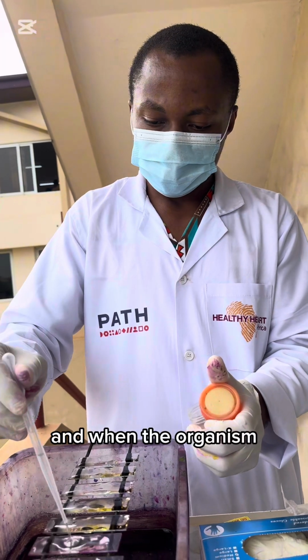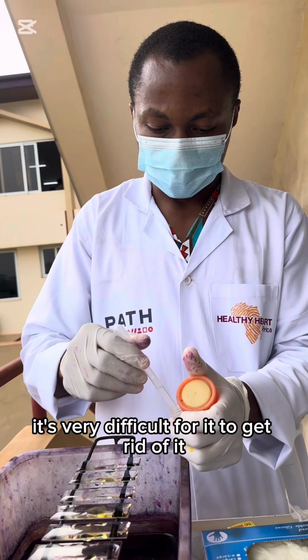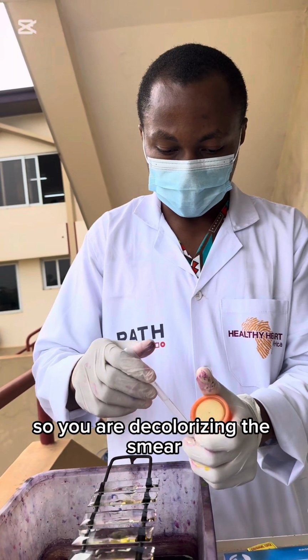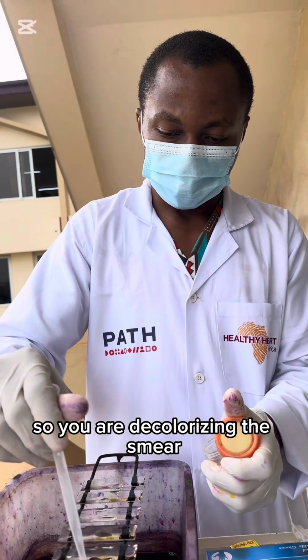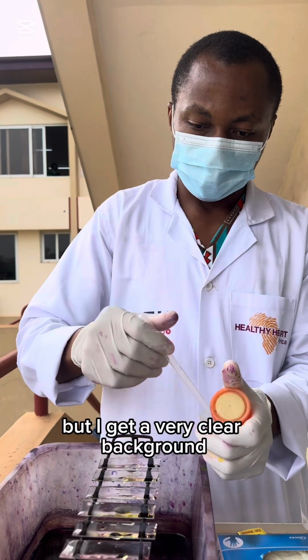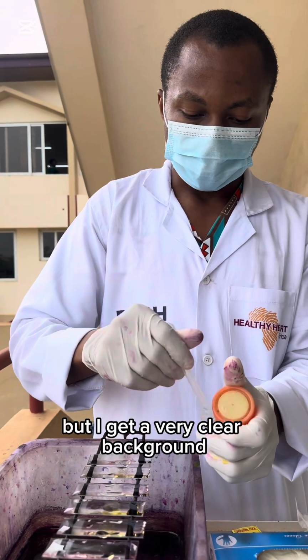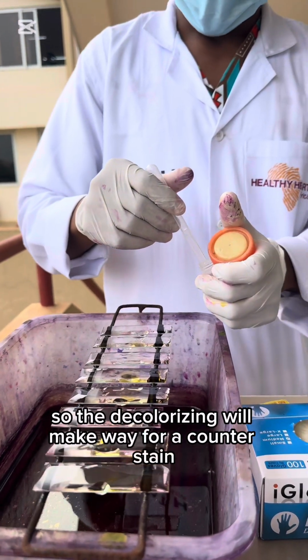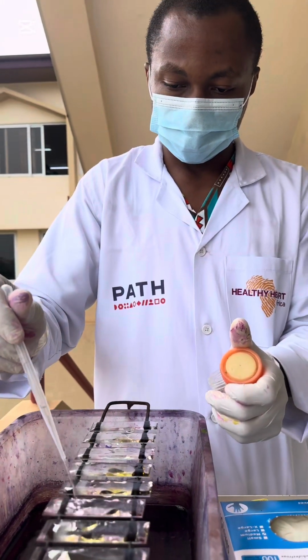And when the organism is able to pick up the carbol fuchsin, it's very difficult for it to get rid of it. So we are decolorizing the smear so that I get a very clear background. The decolorizing will make way for our counter stain, methylene blue.